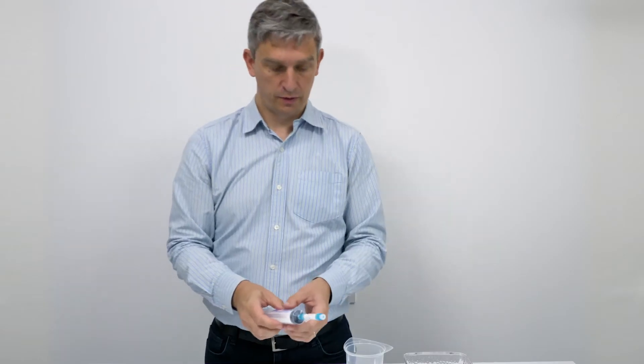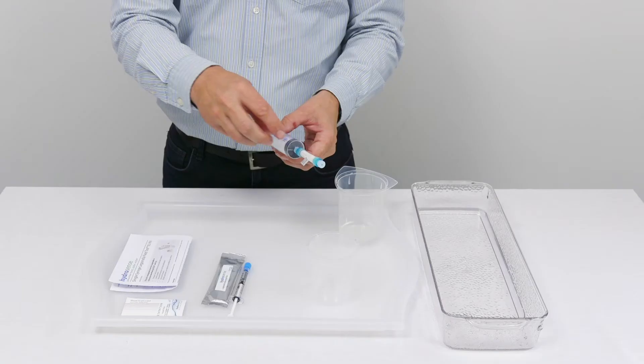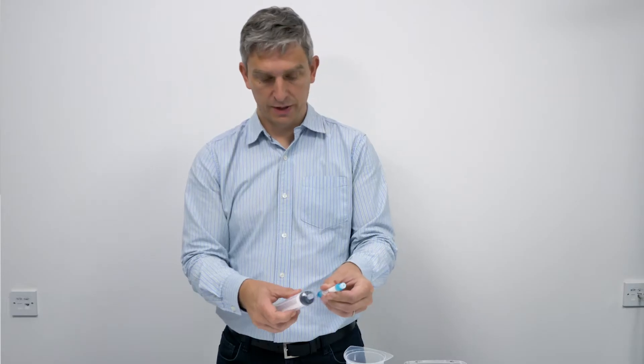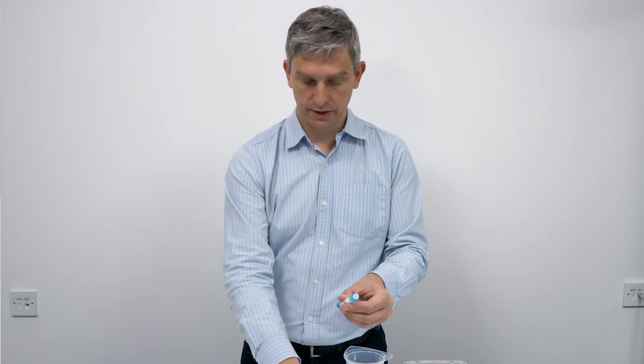Now that we've passed the sample through the filter, we need to extract any bacteria that are present within the filter using the recovery buffer syringe. We can detach the 60 mil syringe.